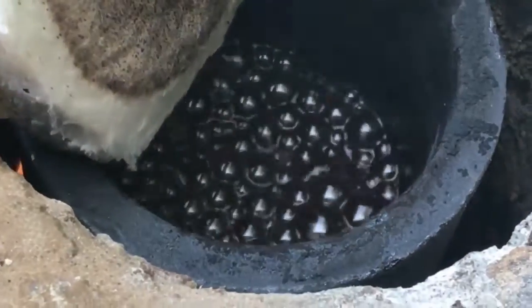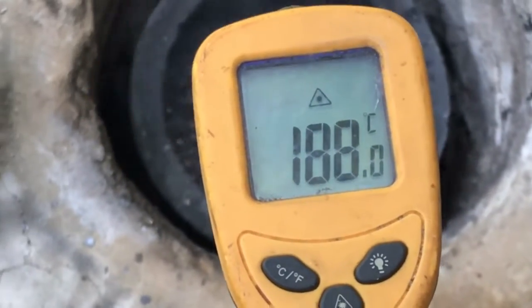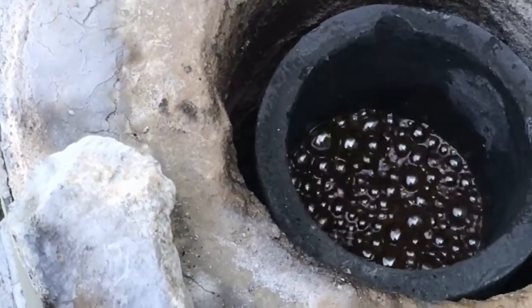I determined it's the same thing as making a bunch of it in the bowl first — it's just a little bit faster and you can make more of it this way. You can see we are holding as close to 200°C as I can humanly keep it with a gas furnace like this.